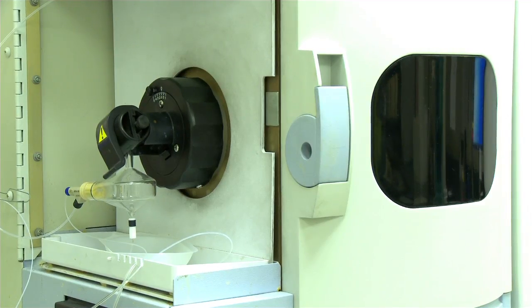The photons are collected and focused by lenses and mirrors, and then there's a very large prism that splits out the wavelengths. The wavelengths are then detected at a photodetector, and they run through a photomultiplier tube. With the magic of electronics and computers, we see a signal at the end.